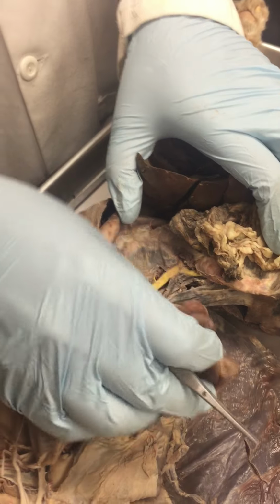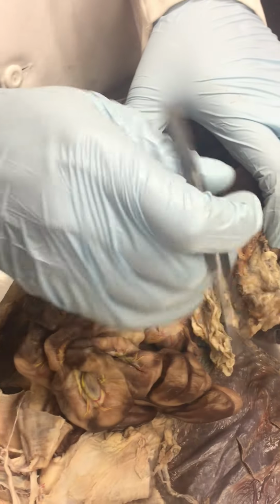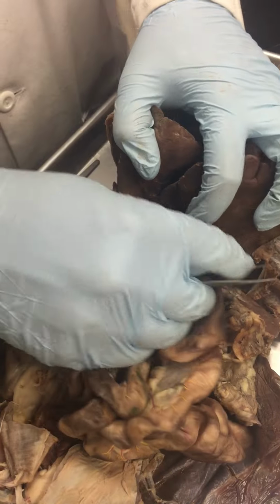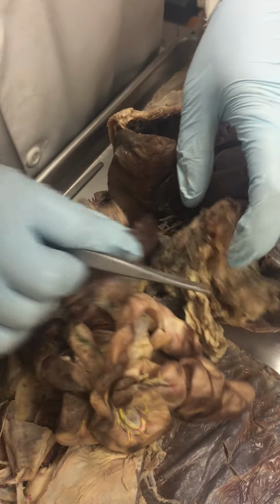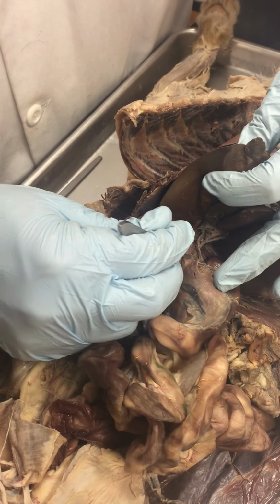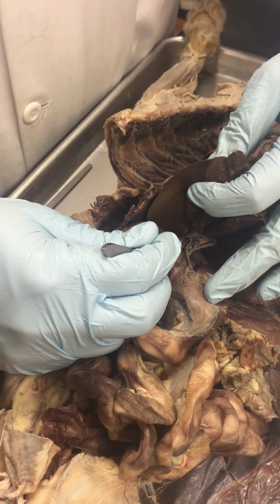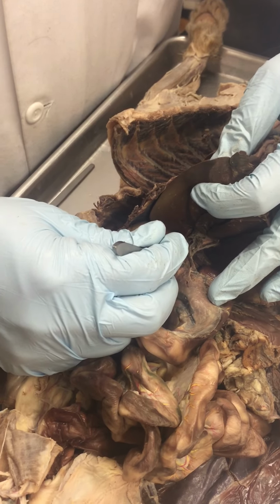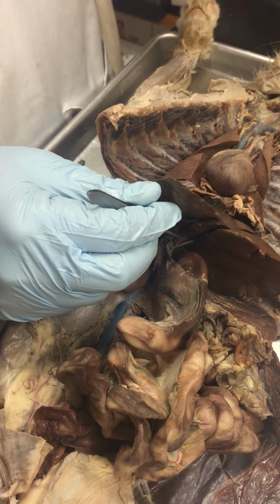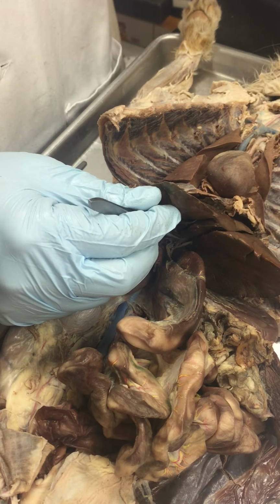All those from the intestine, from the liver, from the spleen and from the pancreas, that blood will go all the way. Okay, it's not fully dissected here. So the final part is the common hepatic portal vein. That's the hepatic portal vein goes to the liver, and the liver has the capability of either redistributing or further processing this nutrient.